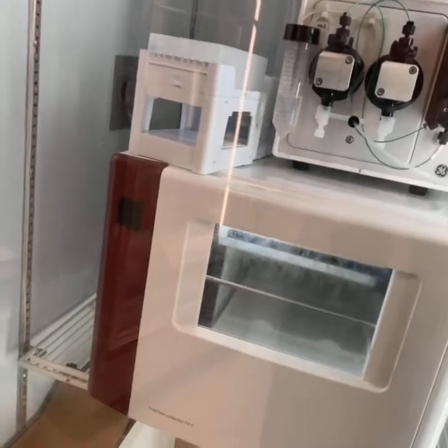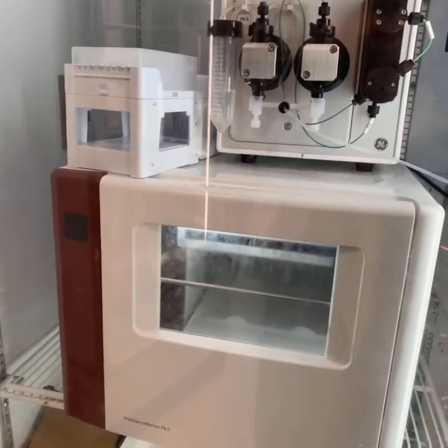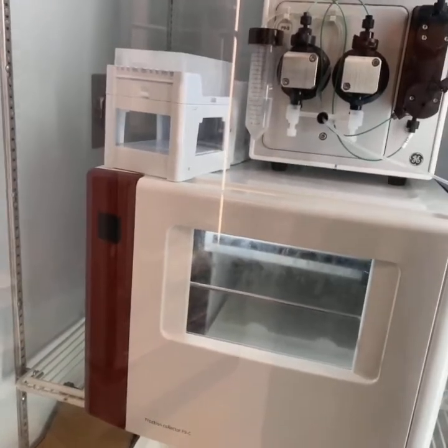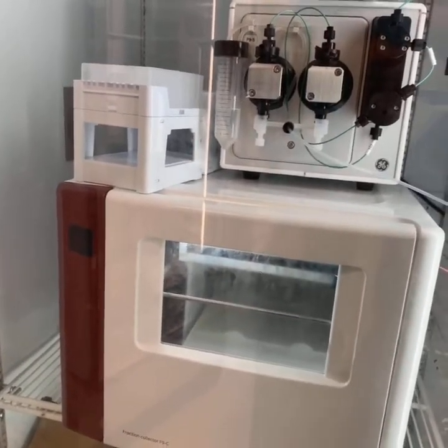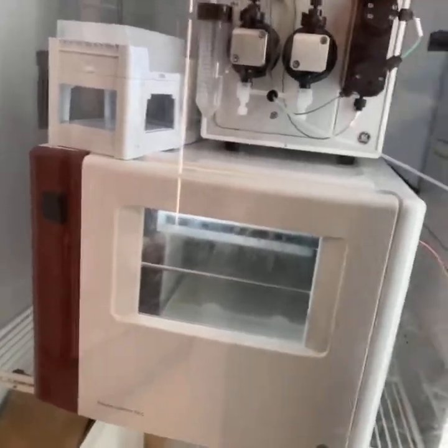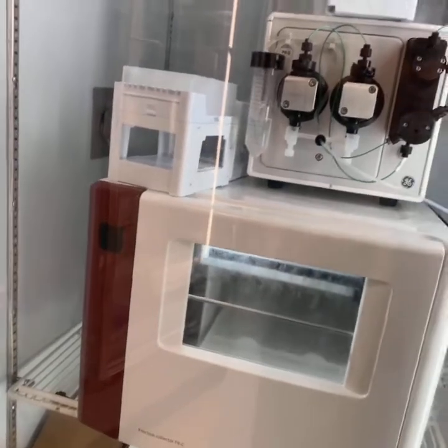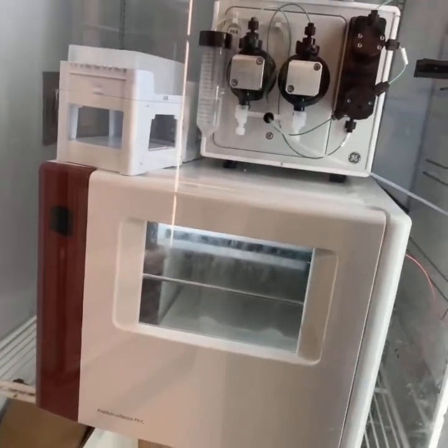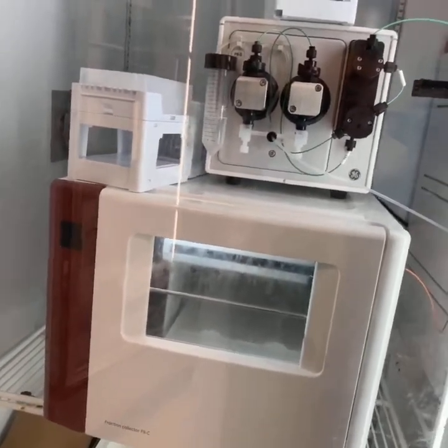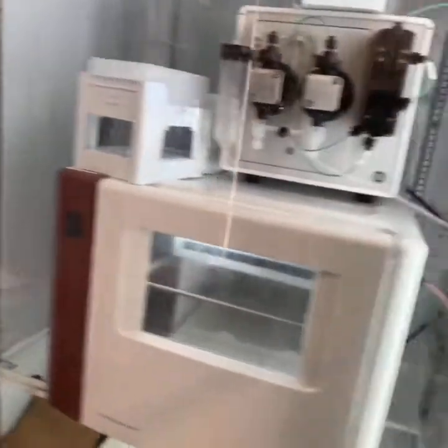One of the signs that you have air in your column is if you look at your chromatograph and you look at the system pressure, the conductivity is going to be all spiky and jagged. And if you look at the fractions they're going to be different sizes. So that can be a big problem. So always check your line. I like to manually prime mine before the runs even if I can't see any air because I've had some bad experiences.